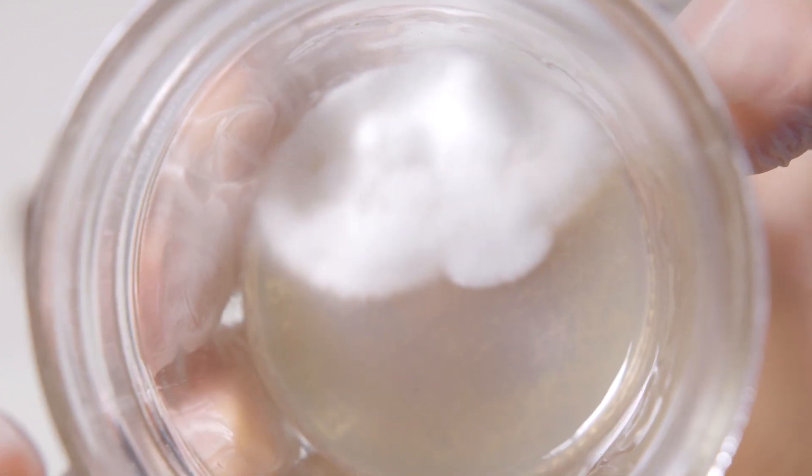And now it's time for our final plate. And to me, it looks like this could use another round of isolation. So I'll go ahead and store it and get back to it at a later date. So let's get to isolating.